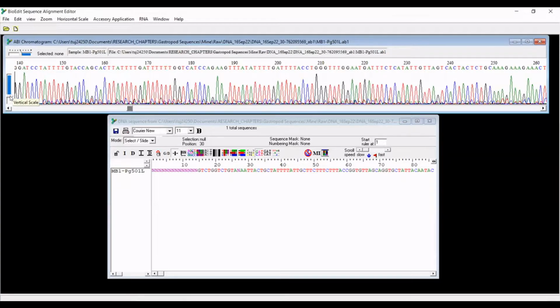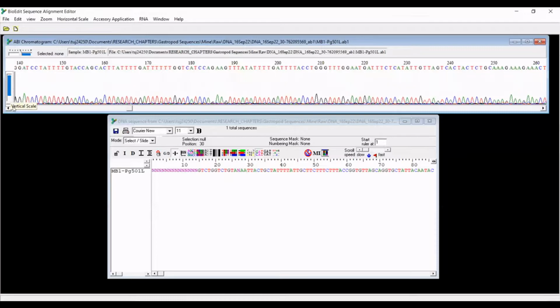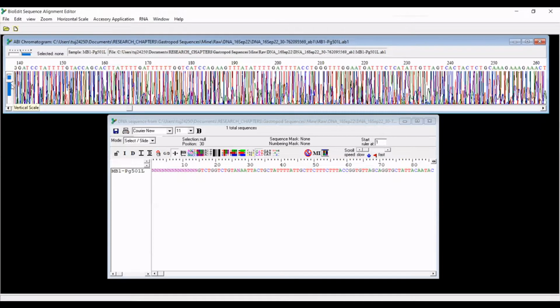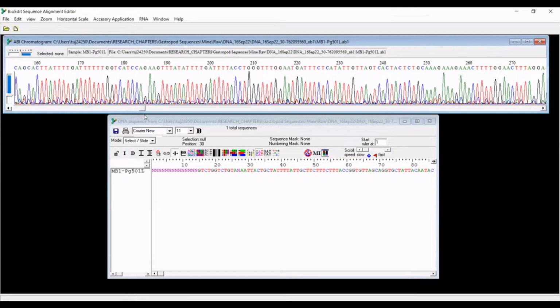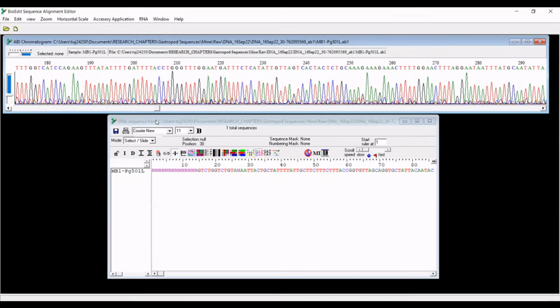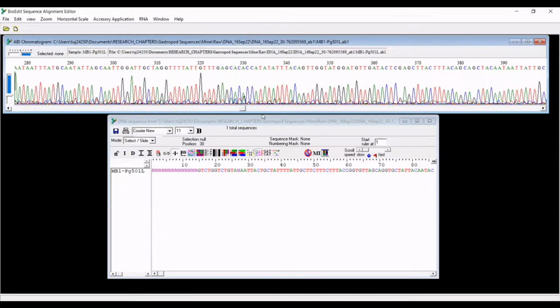And so what I typically do is zoom in. If you adjust this vertical scale, it adjusts the height of the base calls. It usually is pretty good at determining the automatic height that it's set to. But if there's ever a read where I'm really trying to figure out what happened, it's useful to know that you can zoom in that way.